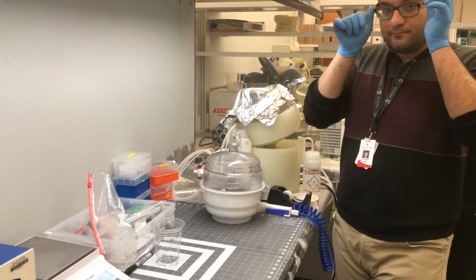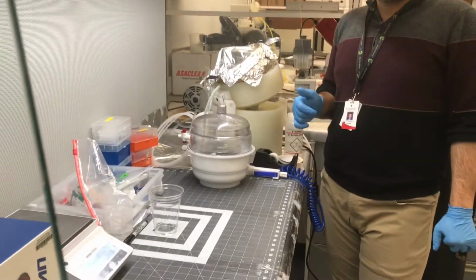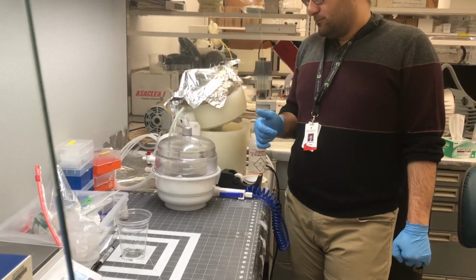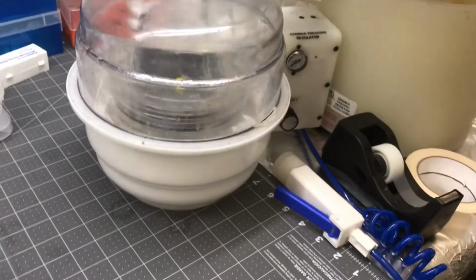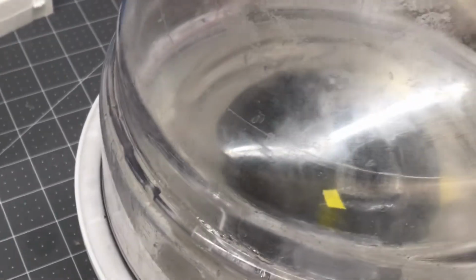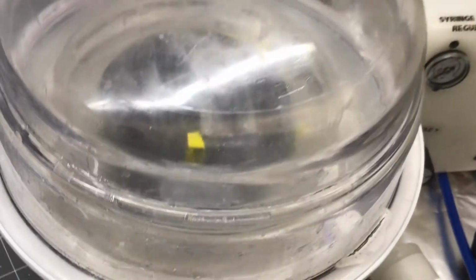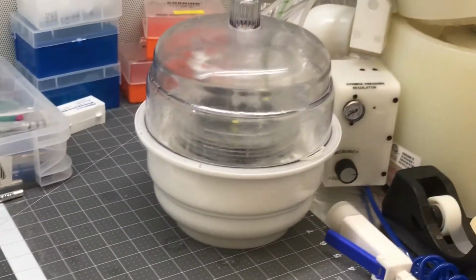Okay, you put those petri dishes with the chips in, and you cover them with another dish. How does it remove the air if they are covered? It doesn't matter. Now you can see the bubbles coming out. At first there is no bubble, but you can see them at the edge of the cover. It's not completely tight, there is air here. Just wait, and it will cover the whole chip with bubbles.